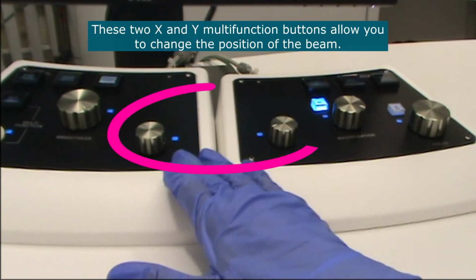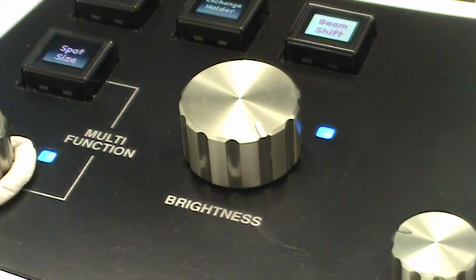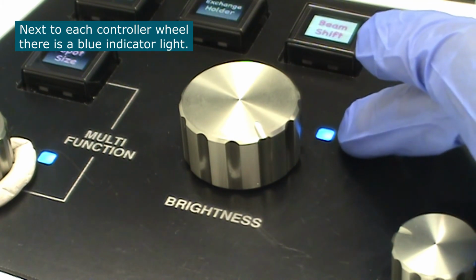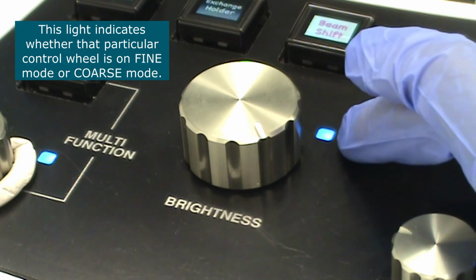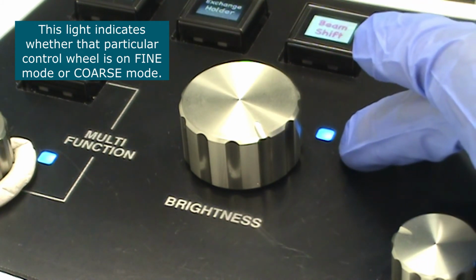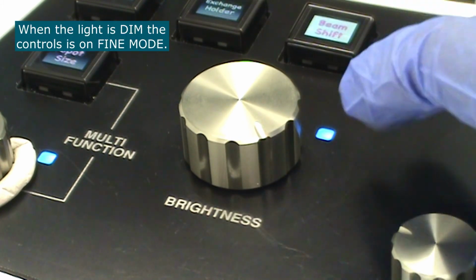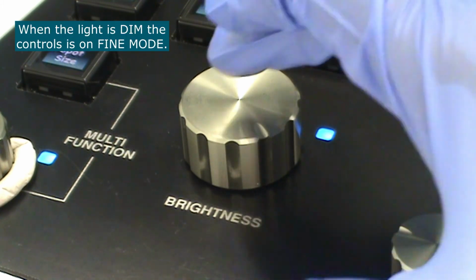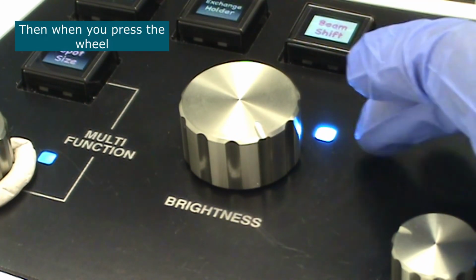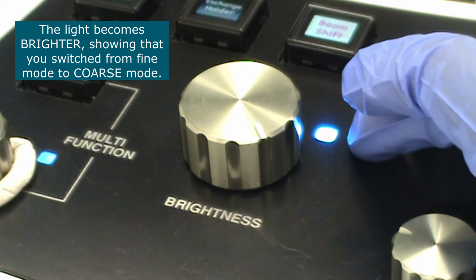These two X and Y wheels here, they allow you to change the position of the beam. Next to each controller wheel, there is a blue indicator light. This light indicates whether that particular control is on fine mode or coarse mode. When the light is dim, the control is on fine mode, and if you press the wheel, then the light becomes brighter, so you've switched from fine mode to coarse mode.